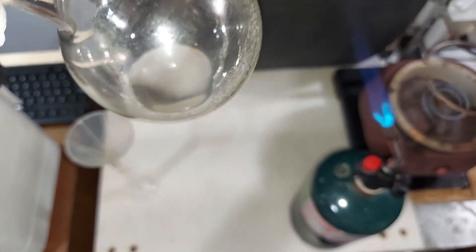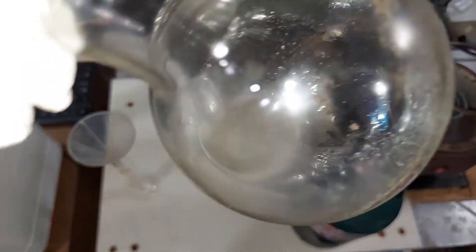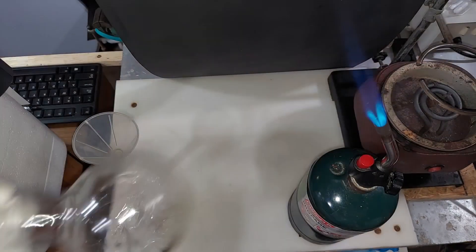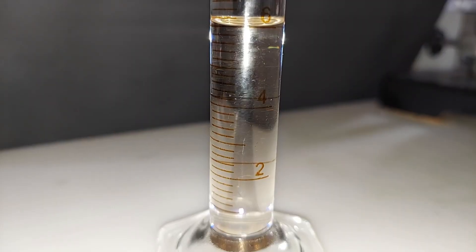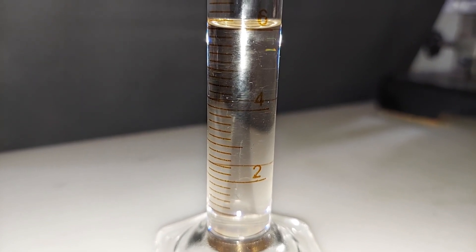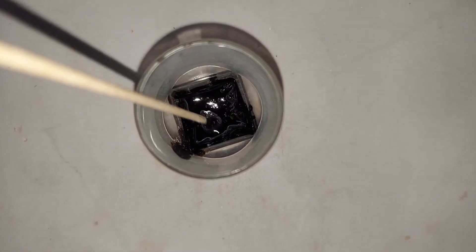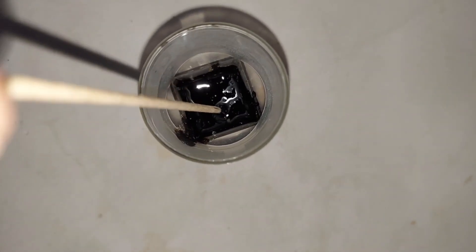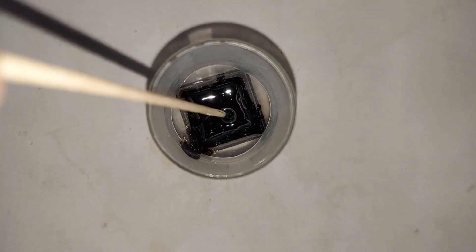This is not the best way to obtain phenol. Buying a bunch of aspirin, making salicylic acid, and then distilling it is just not the way to go — so if you want phenol you should actually purchase it. This is really for educational purposes. It's a little hard to see, but this is 6 milliliters of phenol that came from the 100 aspirins we started with. The substance left on the bottom of that round-bottom flask reminds me a lot of coal tar, which is interesting considering that phenol was originally discovered from coal tar.